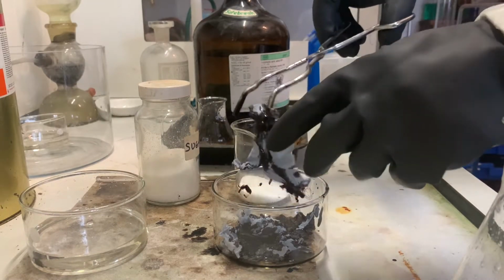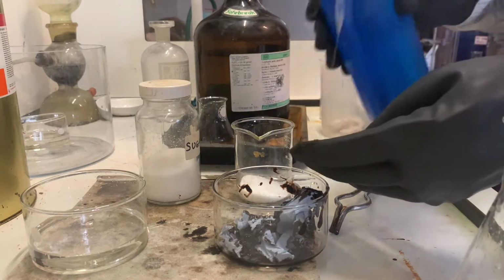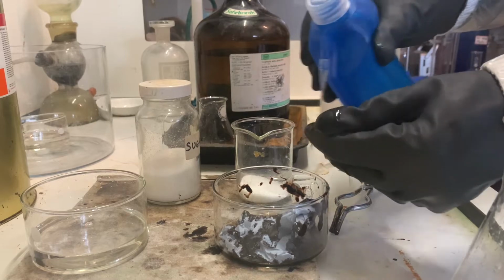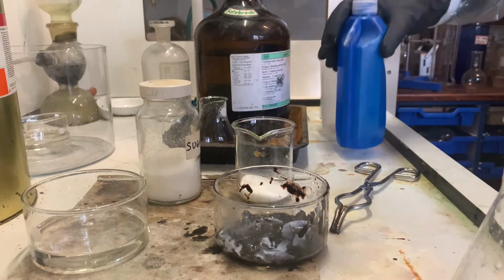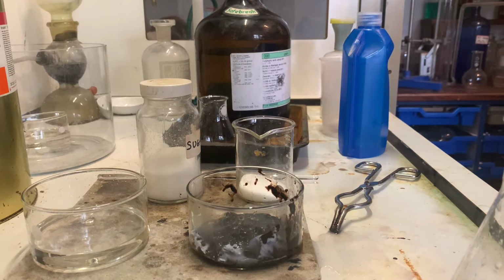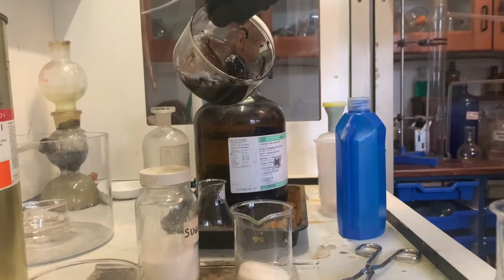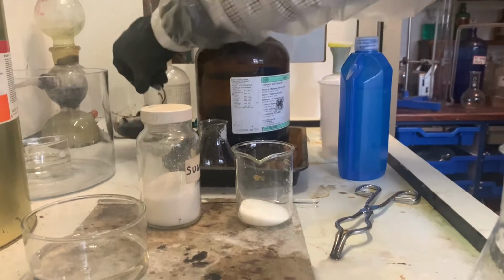Now, the other thing that is very important if you're handling sulfuric acid is to have lots and lots of water about. Even a good bucket of water in the laboratory is always handy, or of course, if you're in a modern laboratory, you'll have a shower of some sort. But it's really good to have, I've got large beakers of water about the laboratory and a bucket outside, just in case there was an accident. So you can see what it's done to just tissue, so there's no point wiping it up with tissue. So we'll put that out of our way.